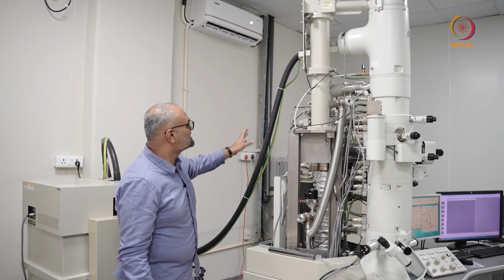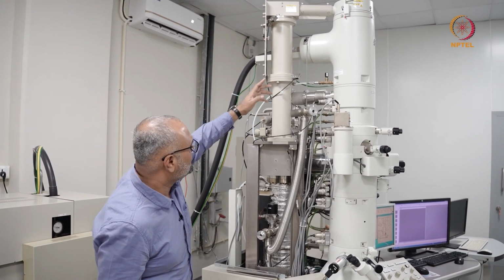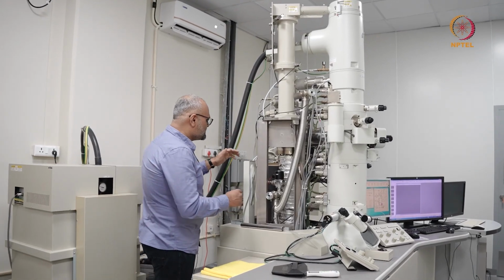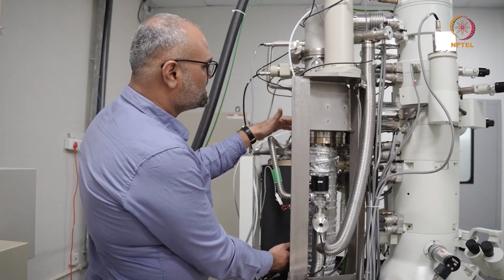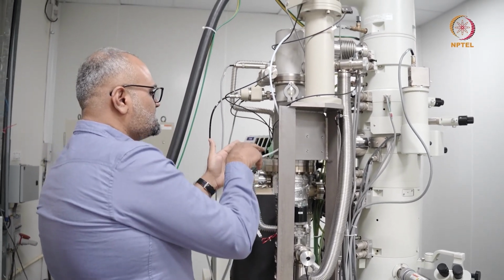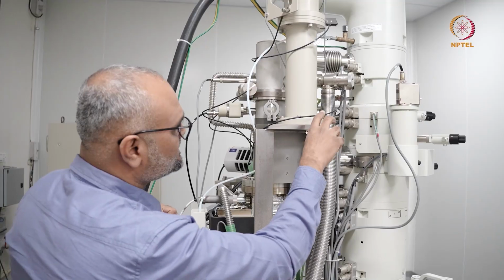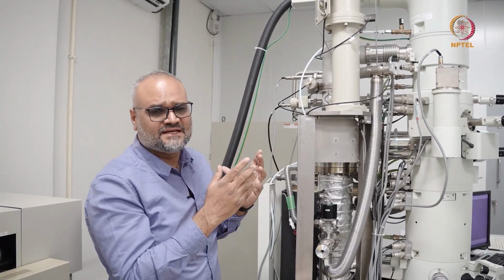So here is the cable which is connected to the microscope column near the source on the top, and the electrons are accelerated through 200 kilovolts in this particular column. If you come a little closer, what you see here is the oil diffusion pump at this portion, and right here it is connected to what, in this particular instrument manufacturer, you call a sputter ion pump. This has a 200 liter sputter ion pump, or the other manufacturer calls it the ion getter pump.